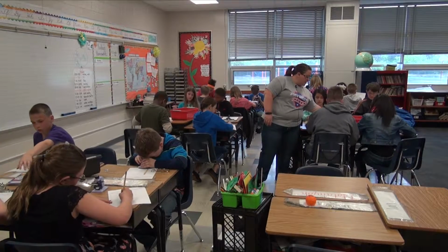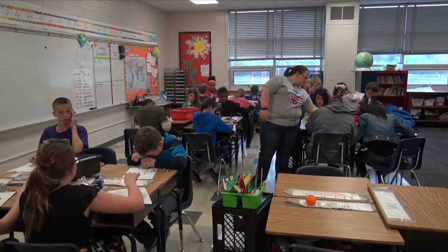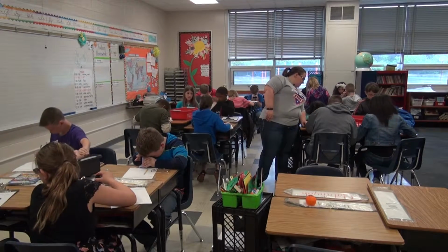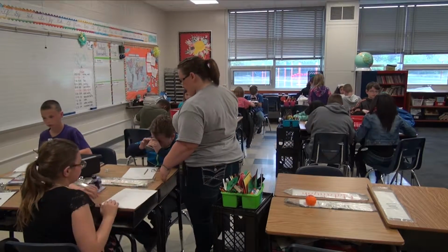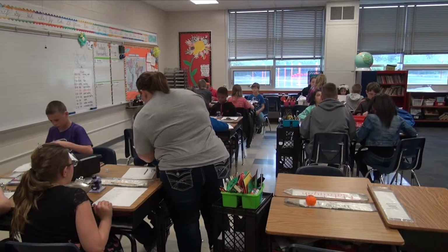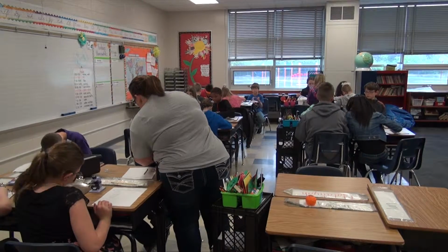Landon, turn your microscope around because your head is blocking. There you go. Oh. Now can you see it? Yeah. How you guys doing? You doing all right? Okay, Kaden, remember, turn the plastic to your tummy. Now, your fingers can't be covering the reflective spot. Try that.